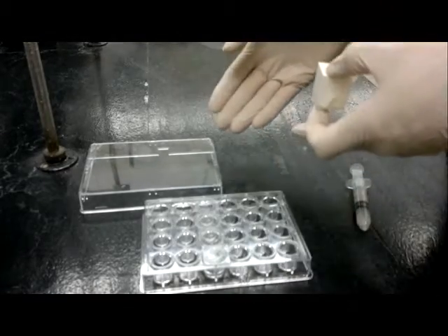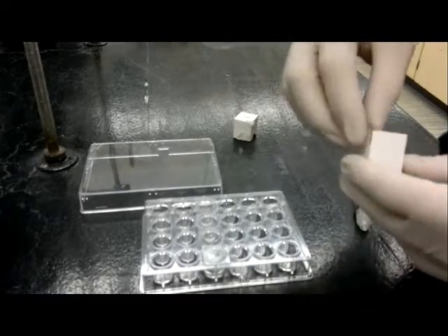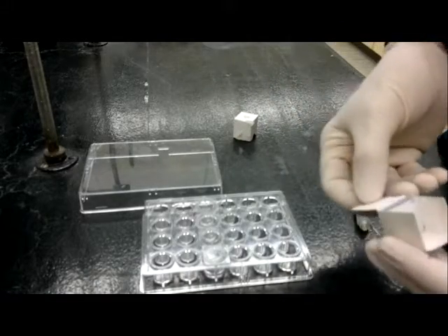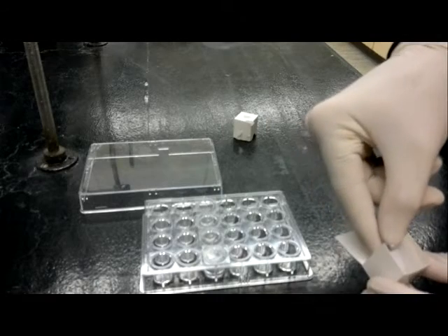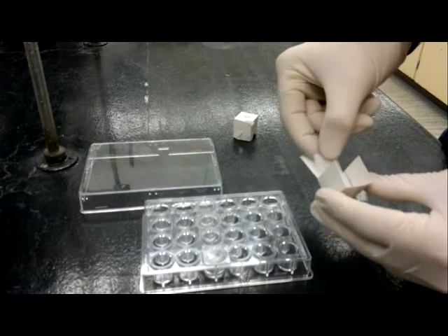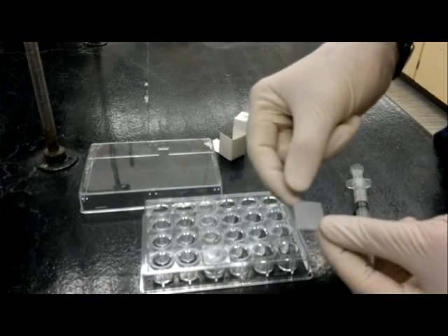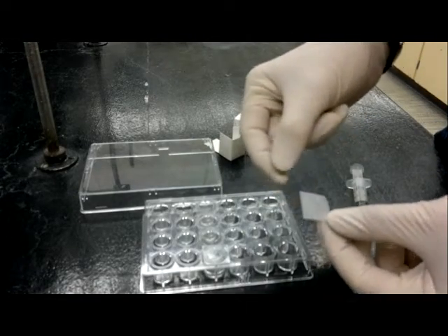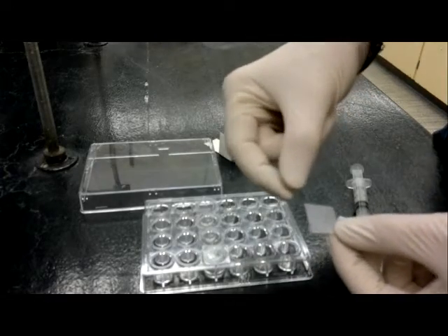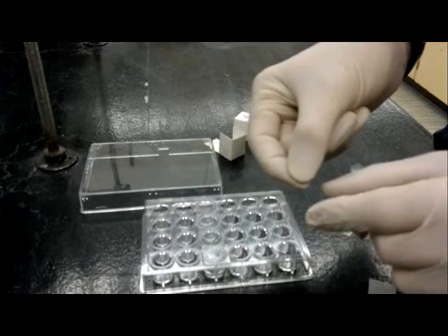Once you've done that, you'll have added a buffer solution to your lysozyme at correct quantities and ratios. You prepare your drop on top of a cover slip. Now the cover slips come in those little cardboard boxes, and they're separated by these little white papers. These papers keep the cover slips from scratching each other and keep them clean. Here's a little hint.